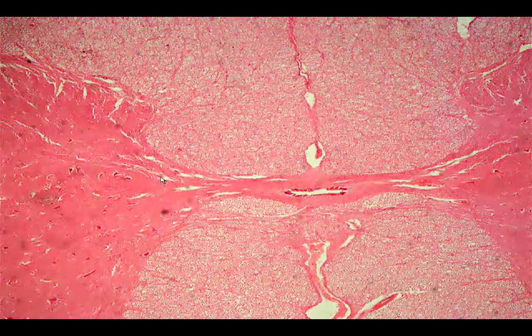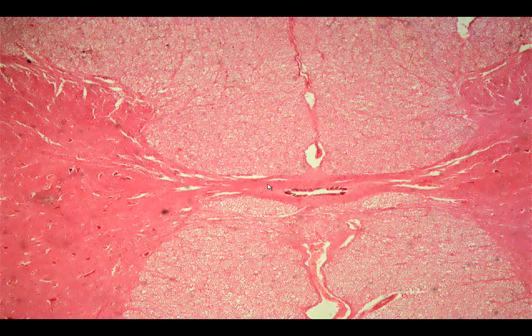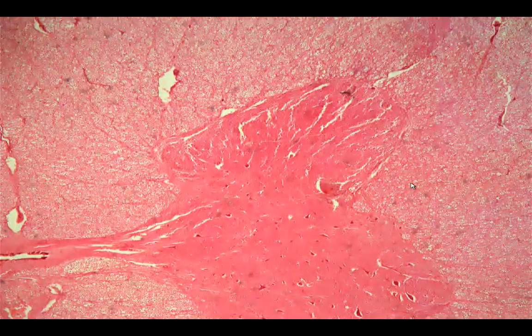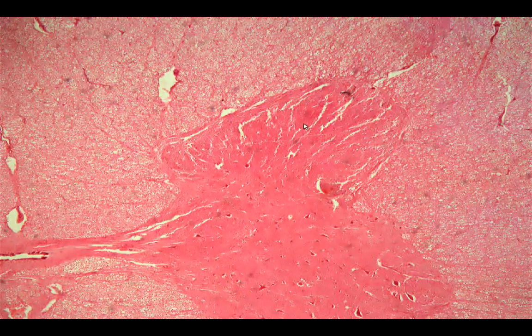Okay. So if we're going to look at the central portion, this is the central canal, and then the connecting sheath would be called the gray commissure. The gray matter would be this butterfly shaped area. Okay, and the one on top would be the dorsal. The one at the bottom would be the ventral, and the one at the bottom would possess the large motor neurons. Okay, so you can see the large motor neurons.